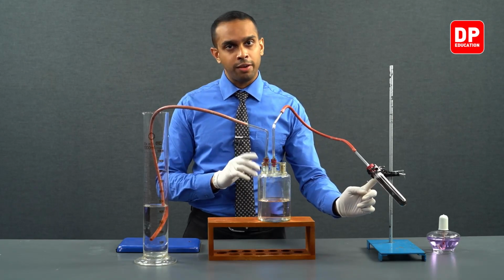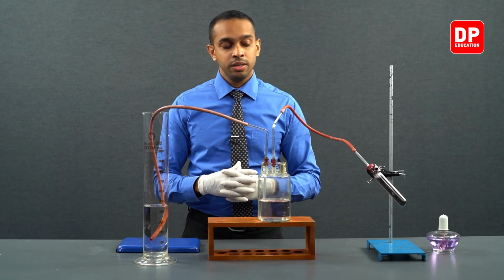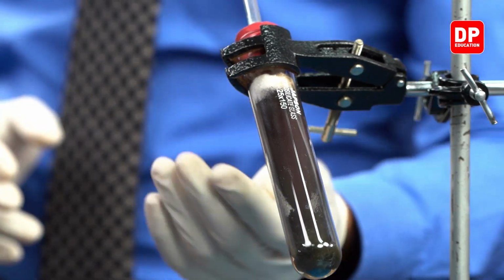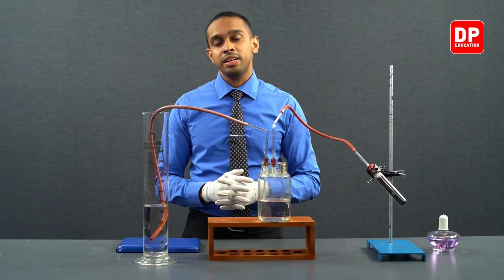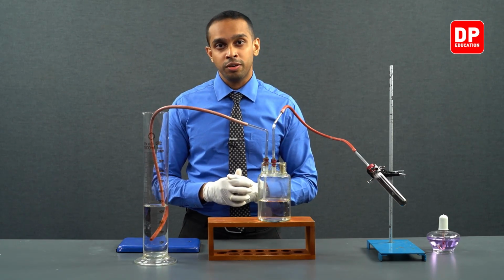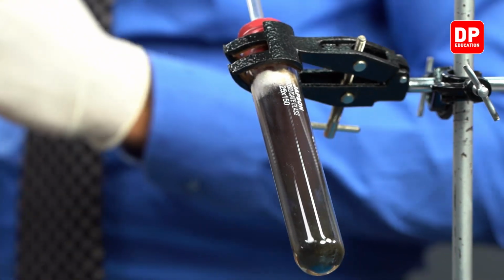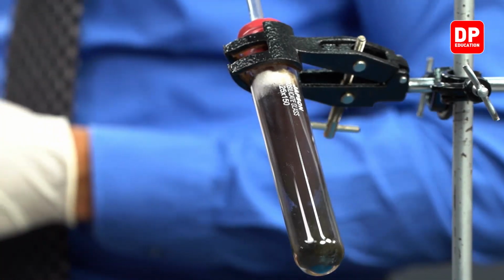Due to the cotton wool piece, the small fine solid particles that were traveling upward did not get introduced into this tubing, meaning the solid particles remained in the boiling tube itself, and therefore it did not interfere with the weight loss that happened due to the formation of oxygen gas. So whatever the weight reduction that you will observe from this point onwards is purely due to the emission of oxygen gas from that sample.